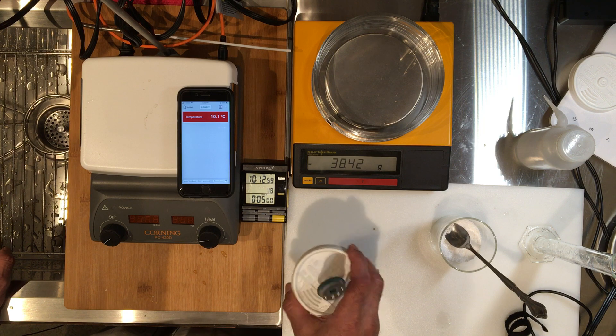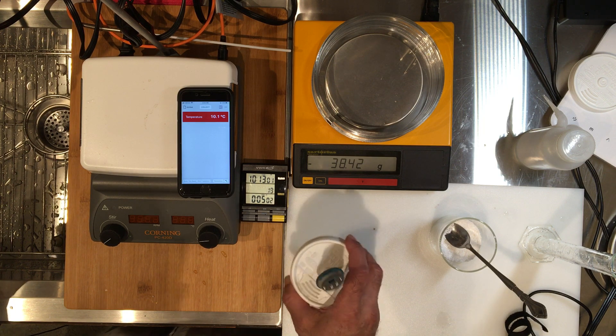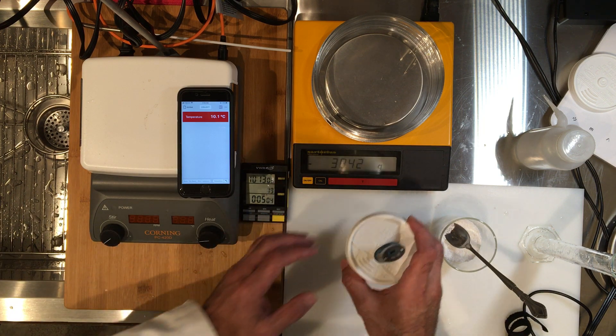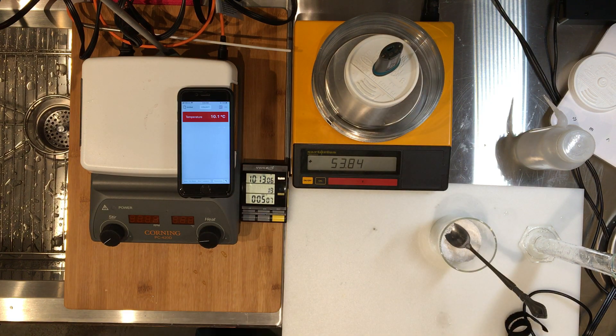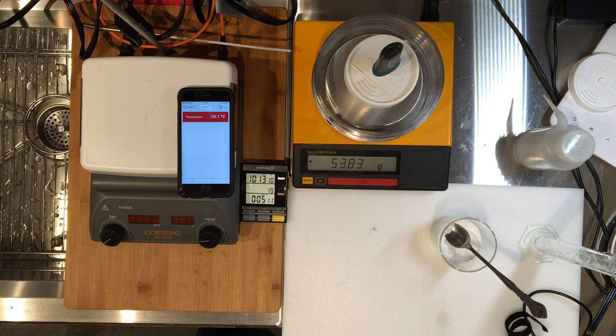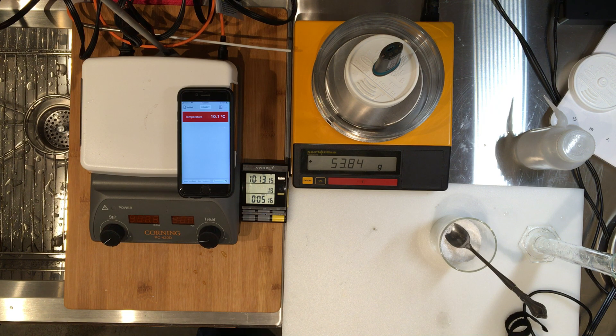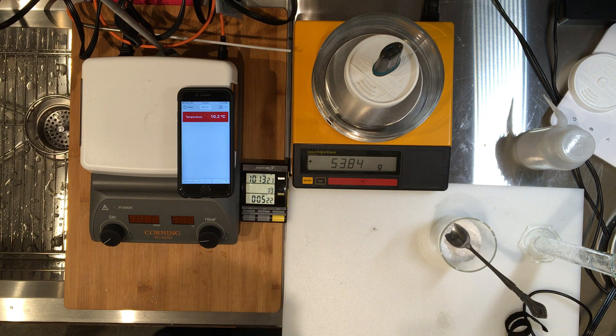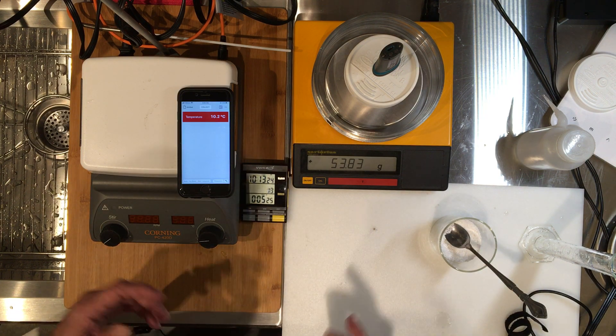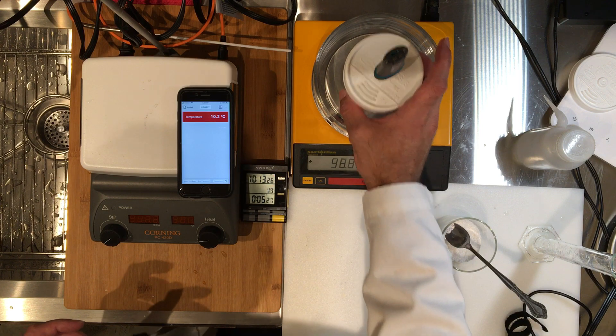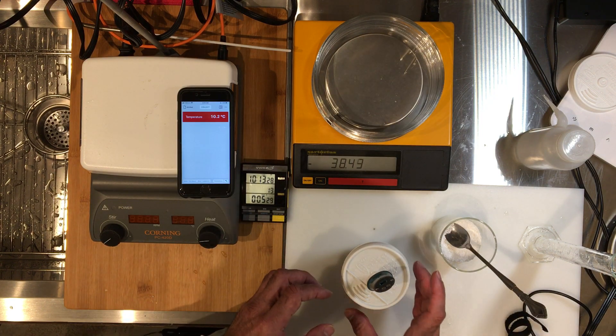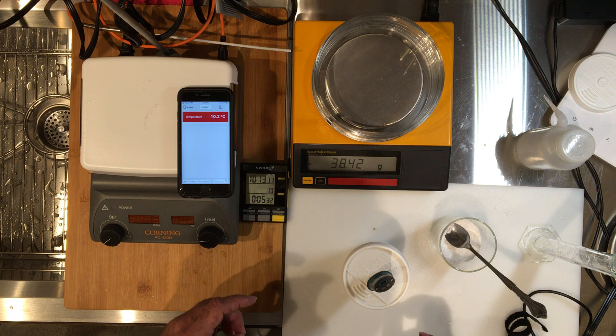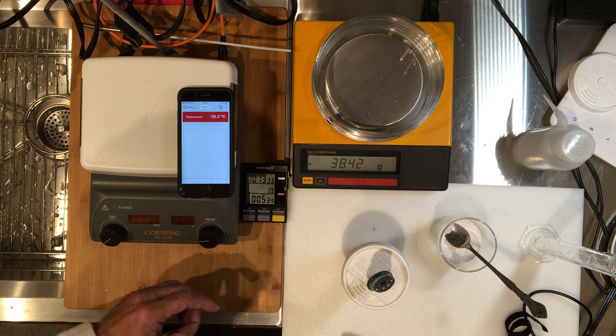Okay, coming up, last temperature. That's it. So let's remeasure the mass. The mass now with the solution, which is water plus the salt, is 53.84 grams. This is the mass that's really called the mass of solution. This trial is over. Trial one is done. We have three more trials to do, so I'm going to stop the video and do the other trials.